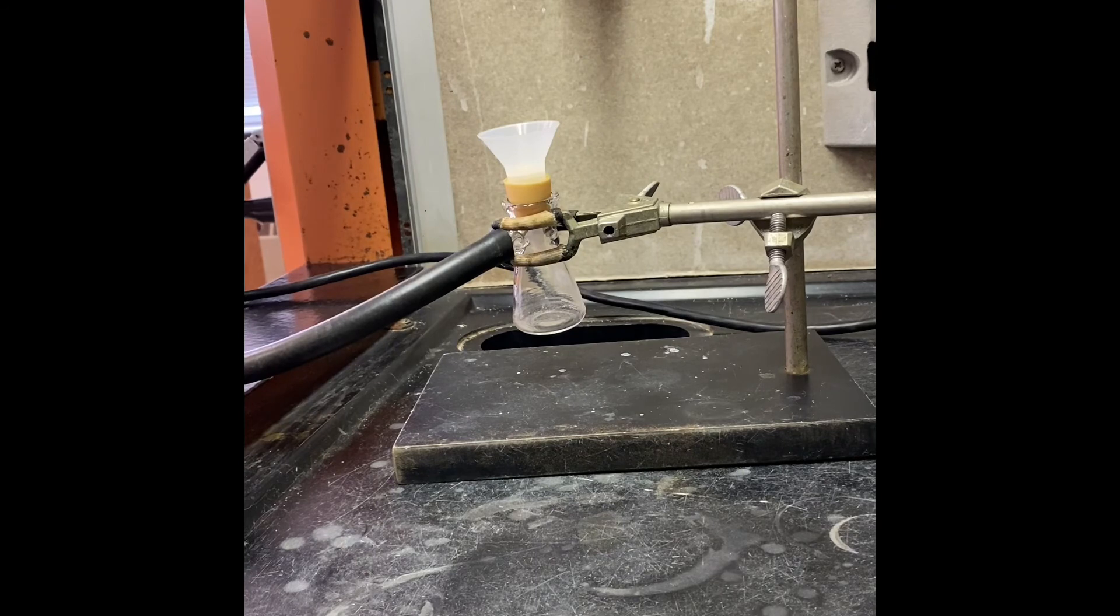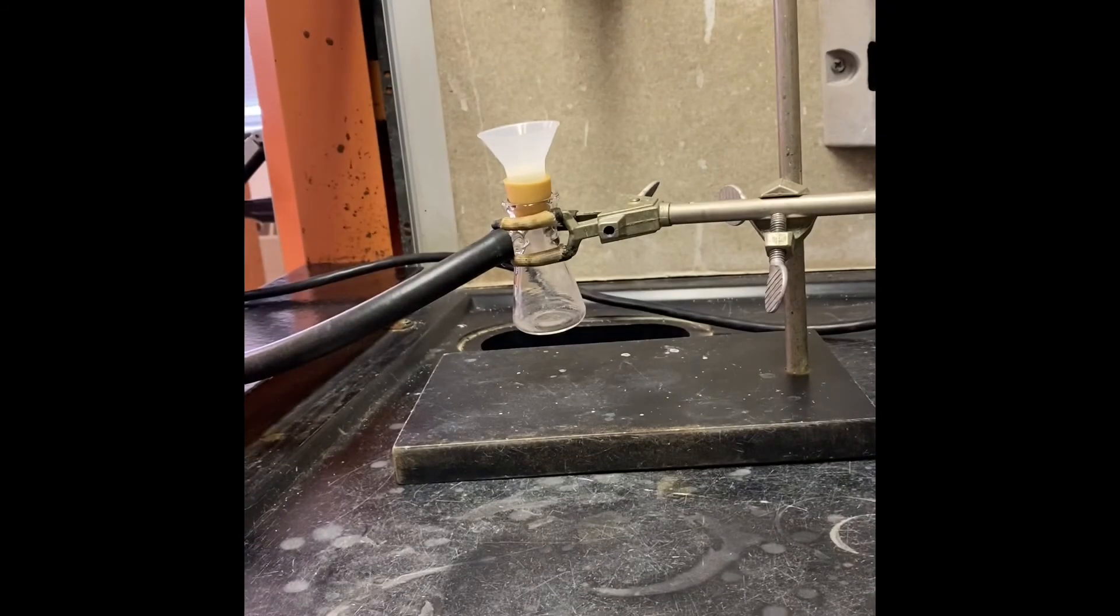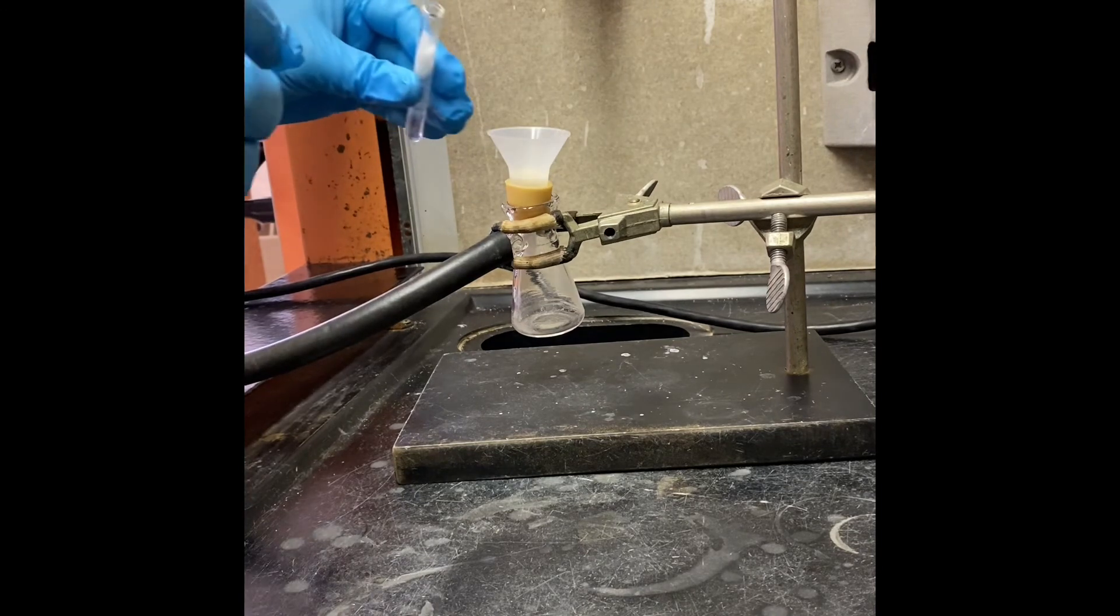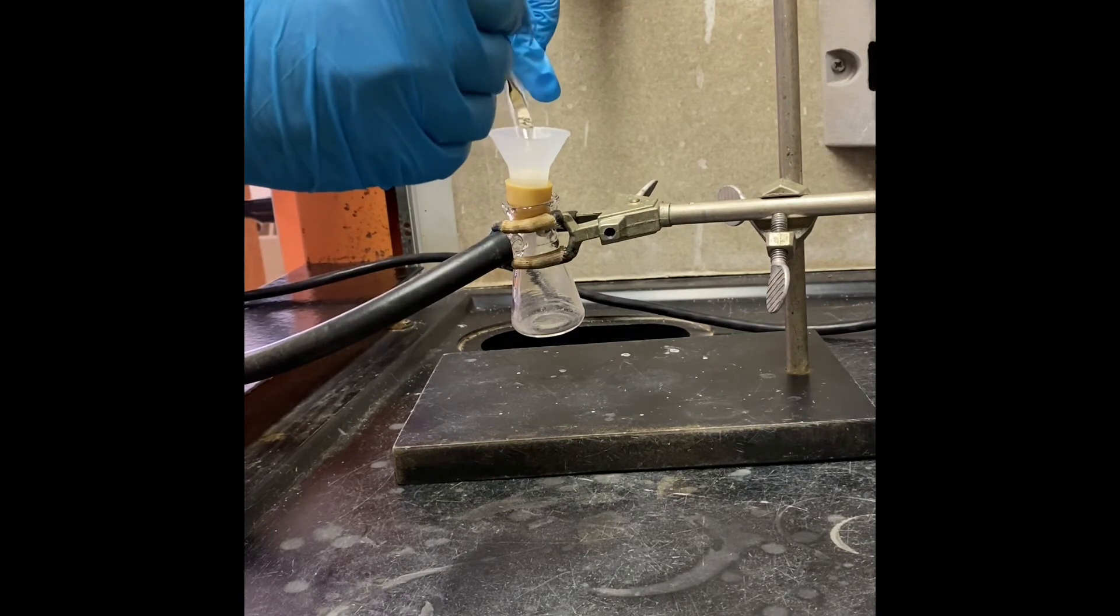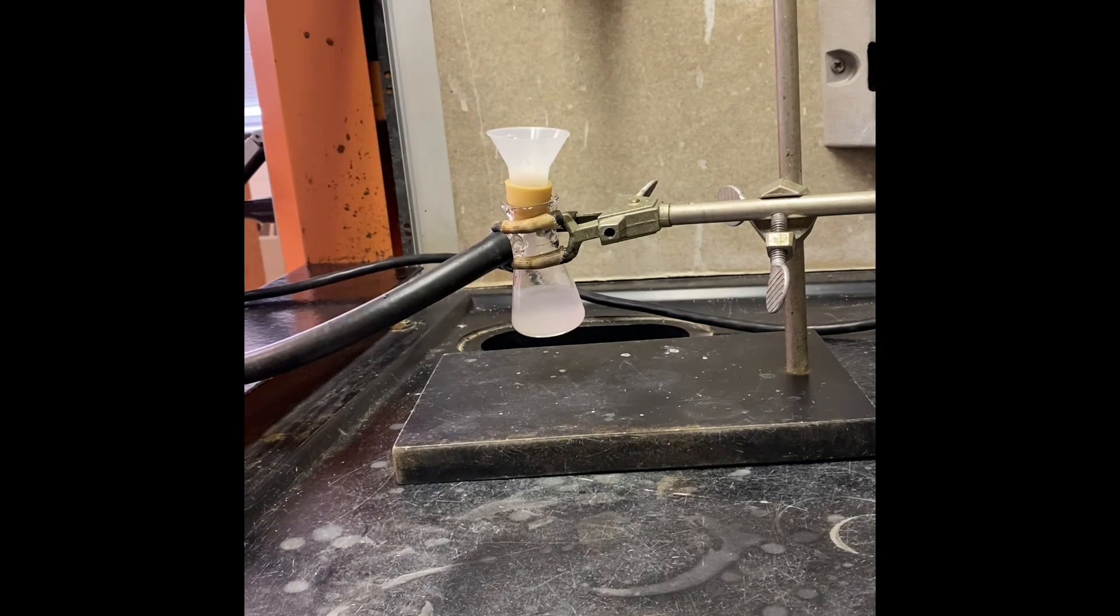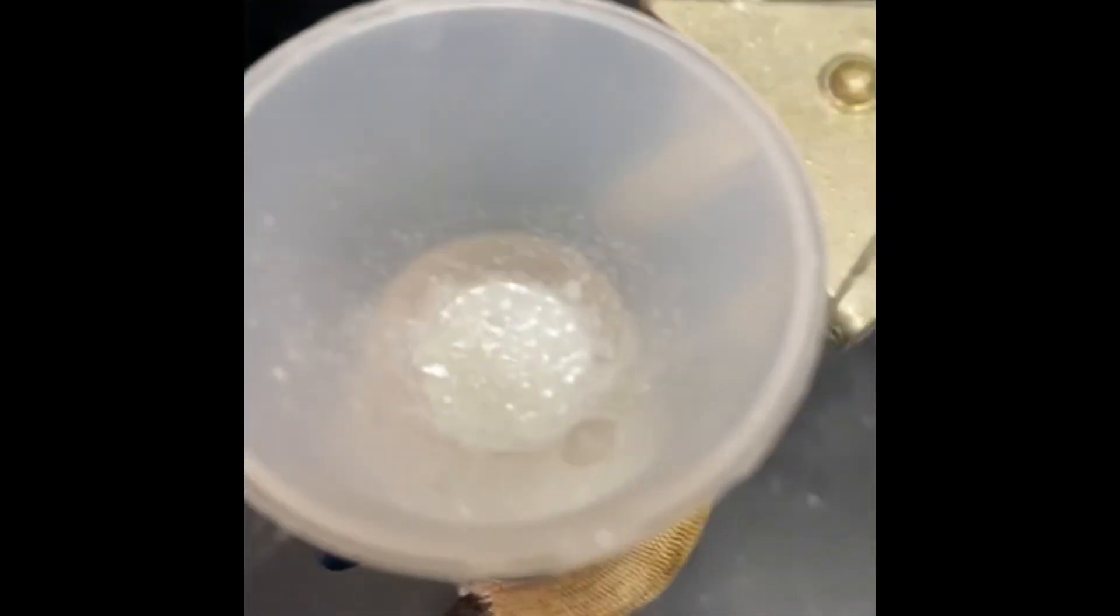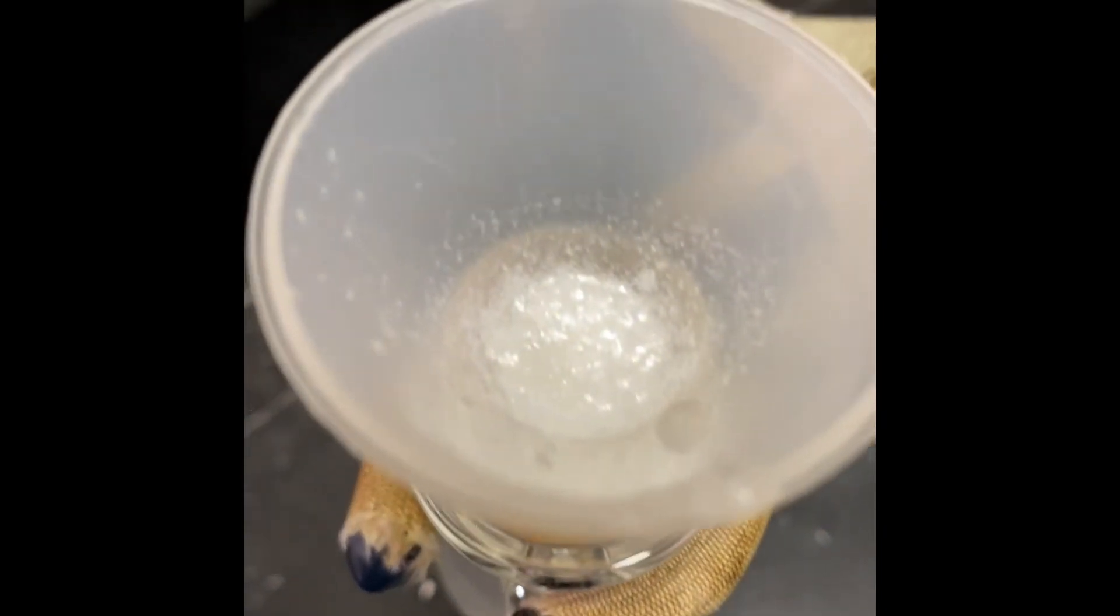That's our vacuum filtration setup and now I'm going to filter our product. We're done with the vacuum filtration and this is our product.